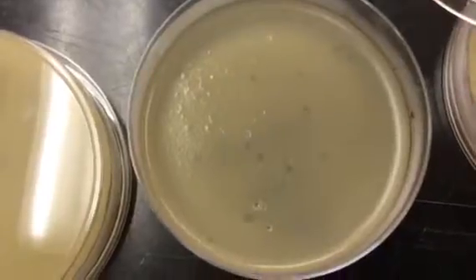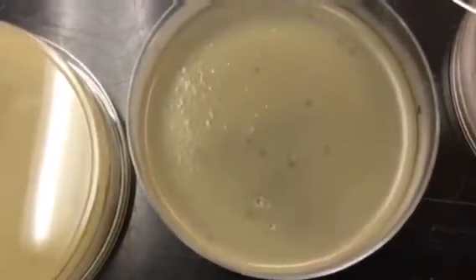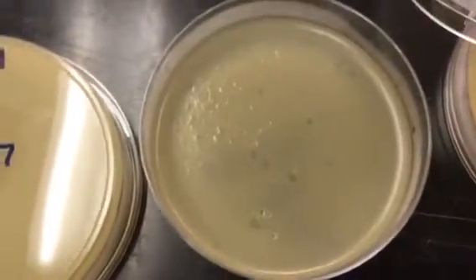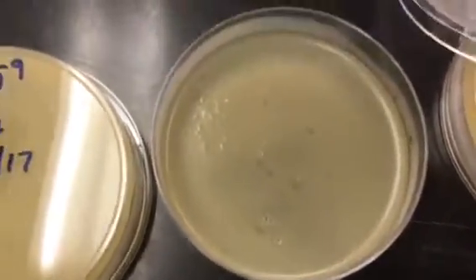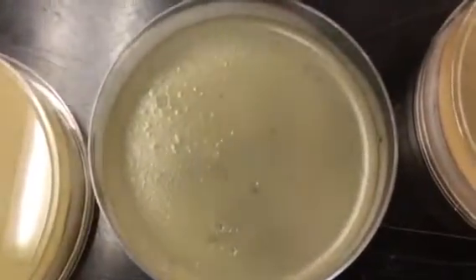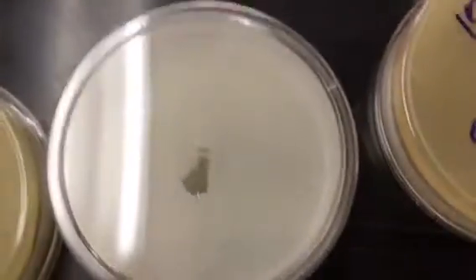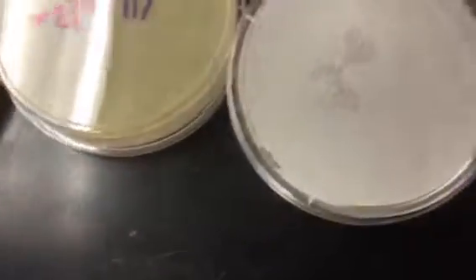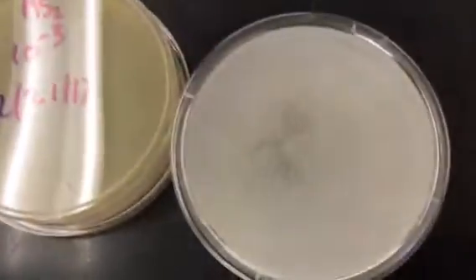So the E. coli lawn itself, when it grows, it won't have this grainy sort of appearance, but after it has the MS2 in there making the plaques, you kind of notice a grainy sort of appearance. But these plaques showed up pretty well, so you're able to determine that those are the MS2. So what we could also do is look over here at some of these that have few numbers to count as far as MS2 goes. So you can see there that that wasn't the one. That was one that he had some clumps in the agar before it poured.